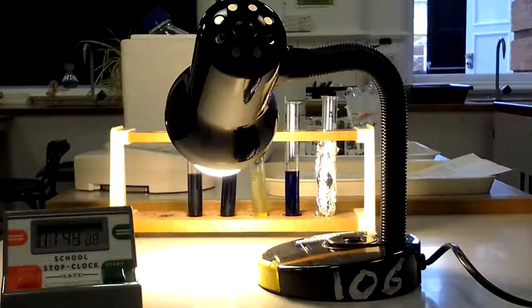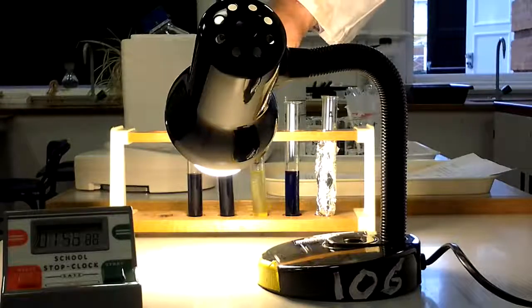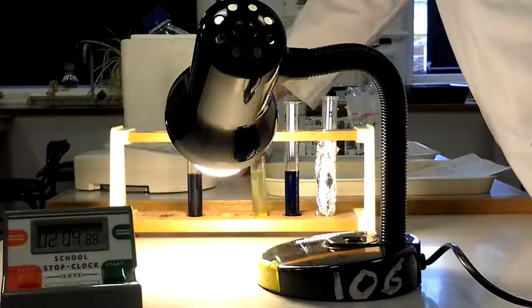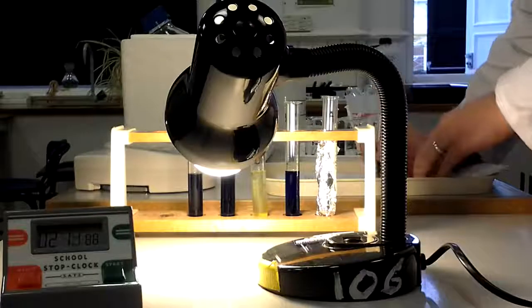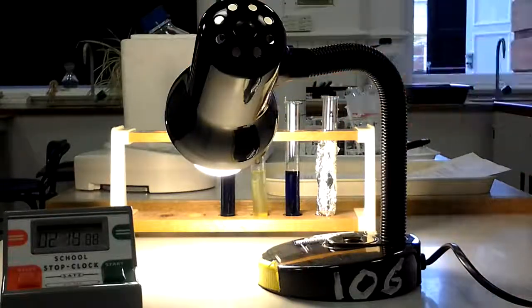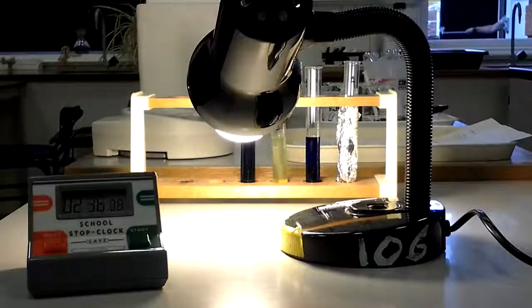We've got about 15 seconds before we're ready to measure both tubes. As soon as it gets to 2 minutes I'm going to pick these up and measure their absorbance. Tube X goes in — I press the T button — and I get a reading of 1.39. Very quickly, tube Y goes in — same test — and it comes back with a reading of 1.41. So at the moment there is a difference between those two of 0.02.